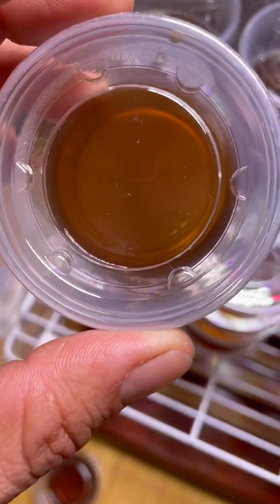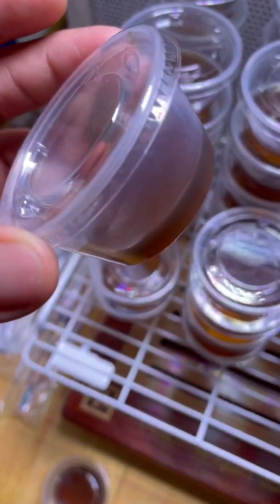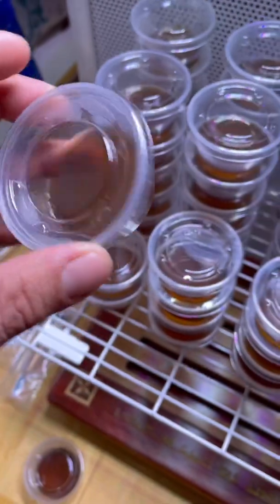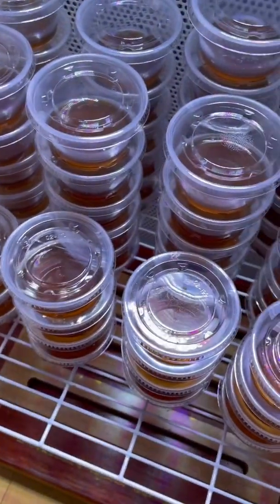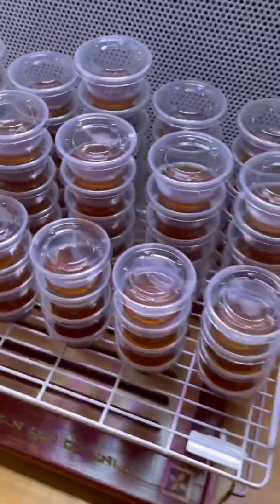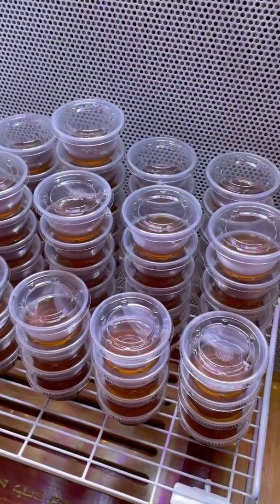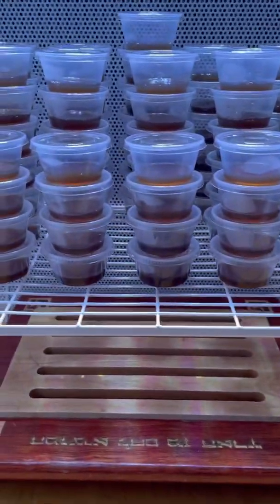I haven't inoculated these. This is actually a tannin agar that I made up. It's my own recipe. It's things that other people use, like light malt extract. I'll use a little bit of tannins, some yeast booster, some Karo syrup, and a little bit of coffee. And I'm just trying it out.